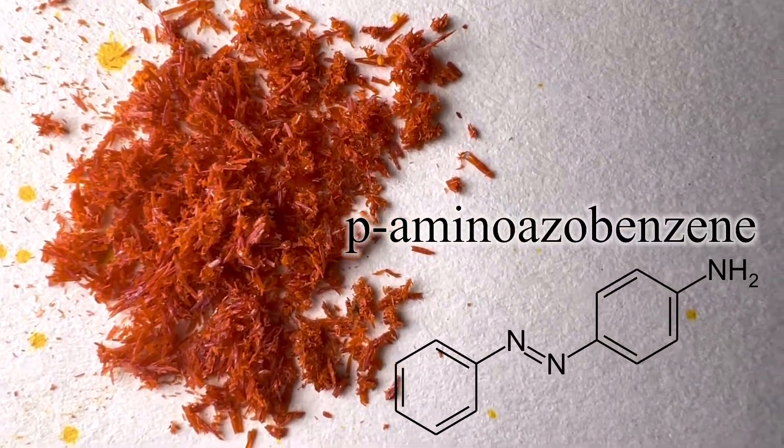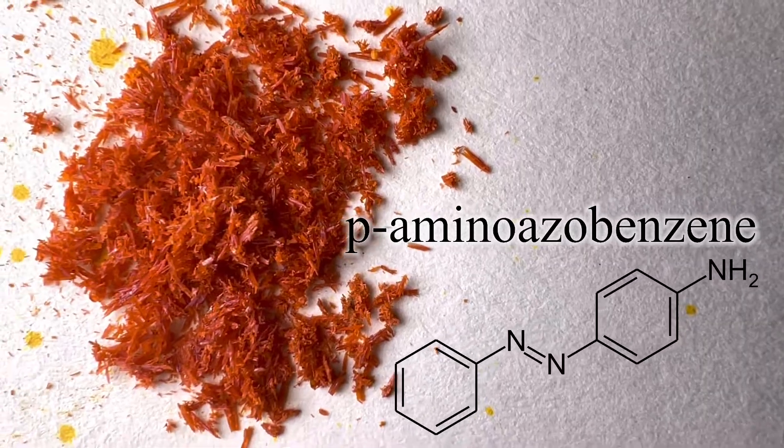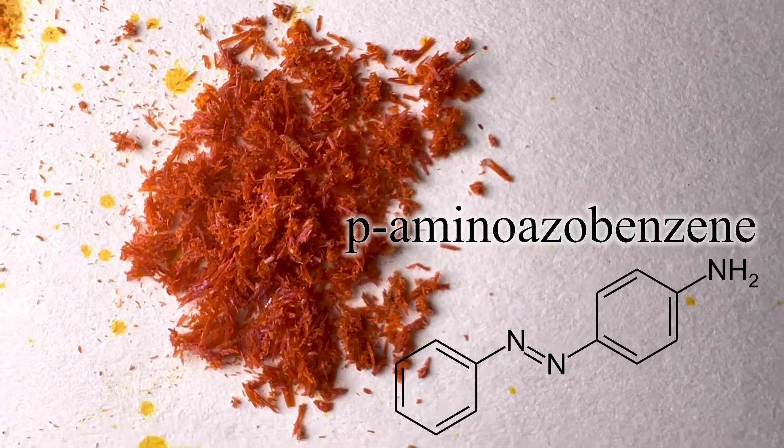Hello friends, in this video, we will synthesize para-aminoazobenzene from diazoaminobenzene.